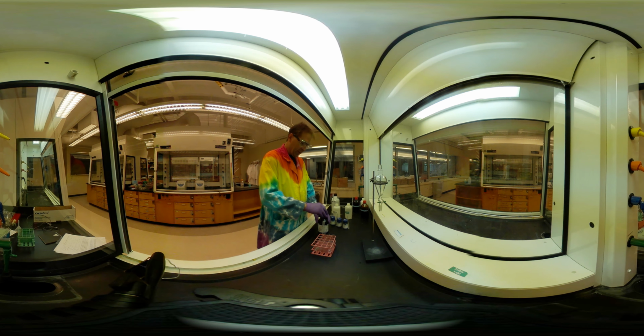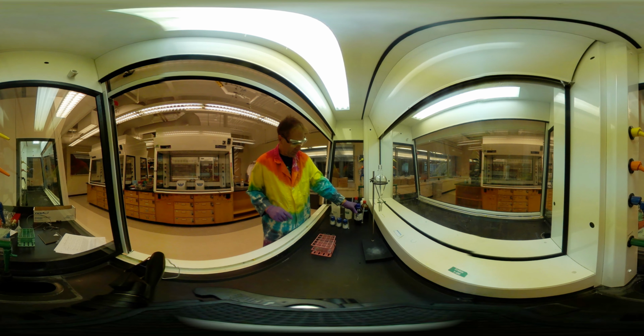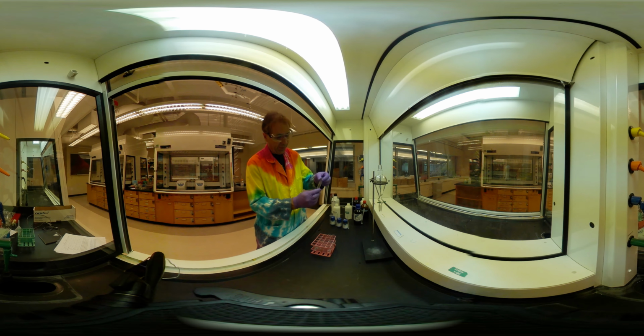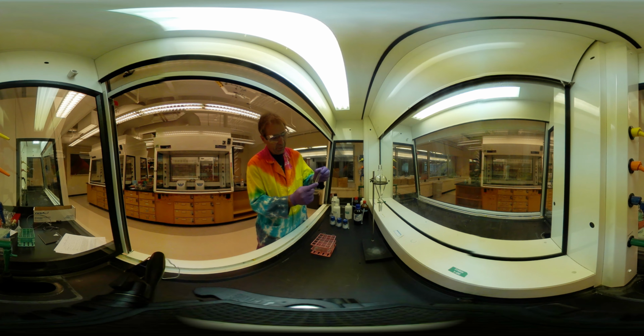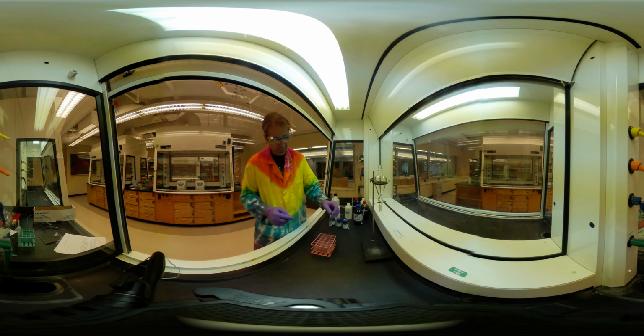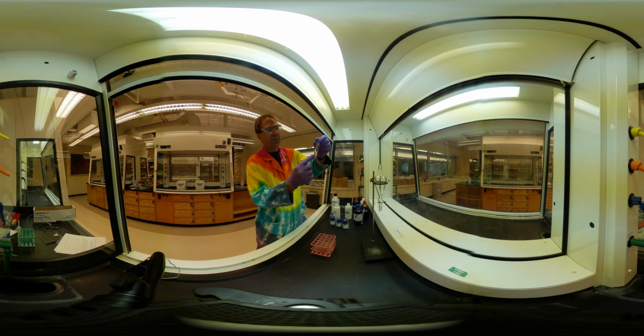Okay. Now we need to mix each one of these. And here's a place where having a lab partner sometimes is helpful, but I'm here on my own today. Okay. So we're just going to go through. Ooh, we're starting to get a result already.